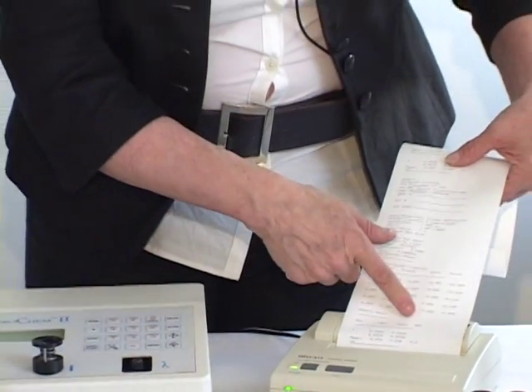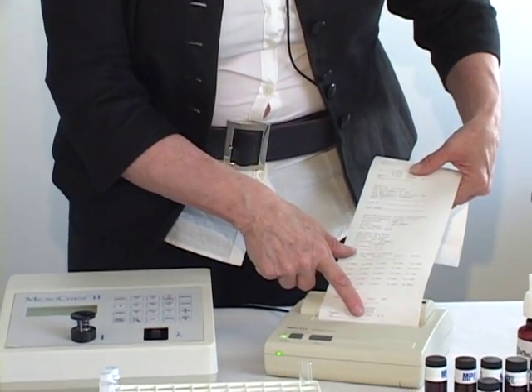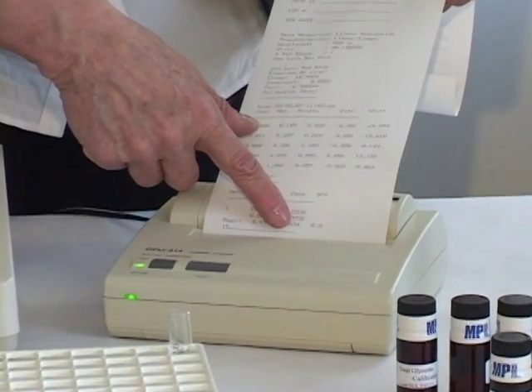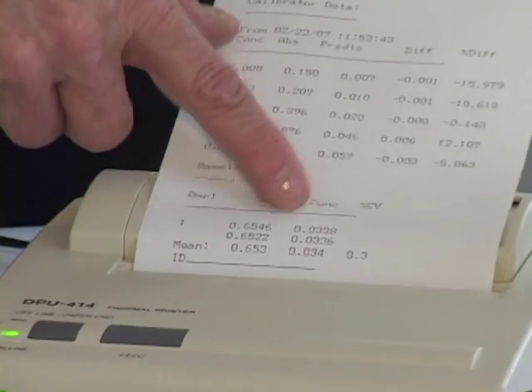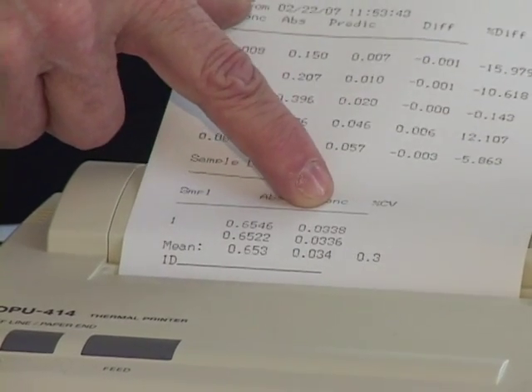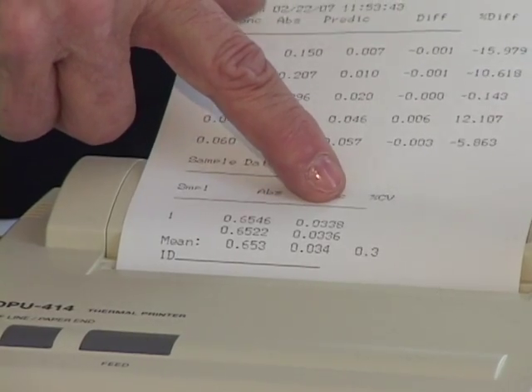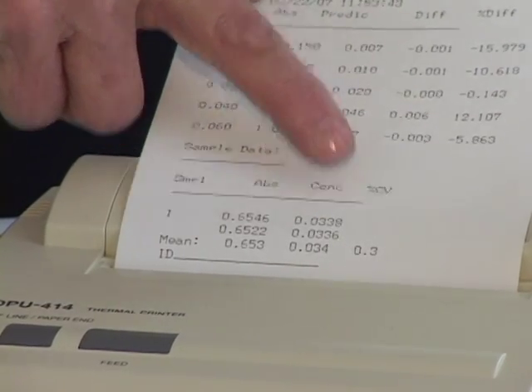At this point, our concentration is 0.034. And remember, we did a 1 to 10 dilution of the biodiesel sample, so the final total glycerin would be 0.34%, over the accepted ASTM limit.